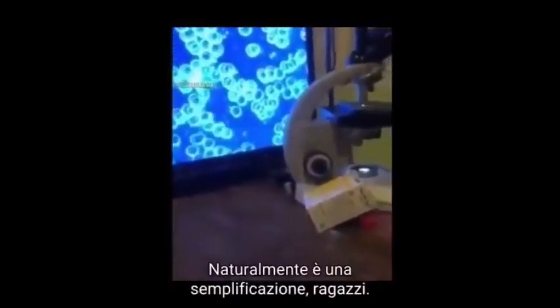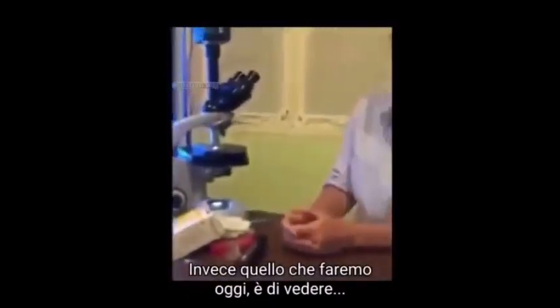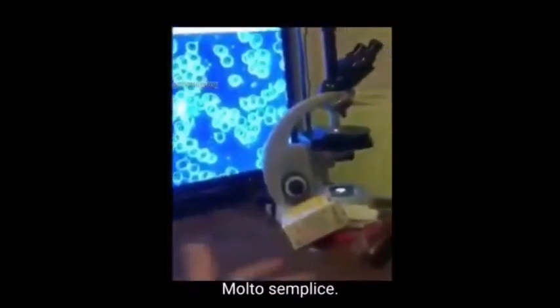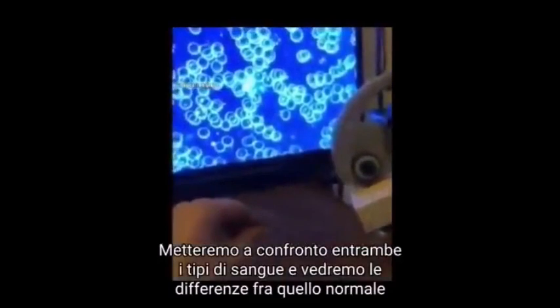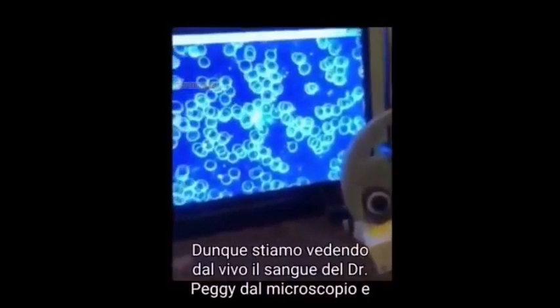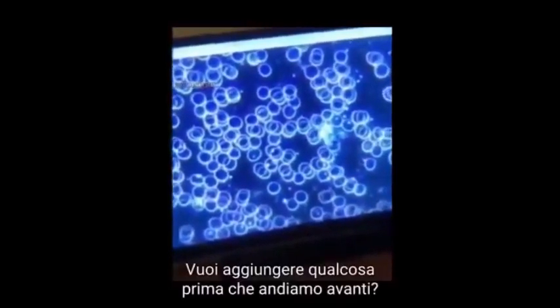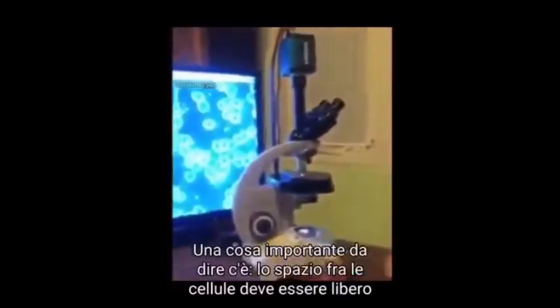This is an oversimplification, guys. What we're going to do today is we're going to see normal blood compared to vaccinated blood. Very simple. We're going to compare both bloods and see normal blood versus vaccinated blood, unvaxxed versus vaxxed. All right, so what we can see, we're looking at a live feed of Dr. Peggy's blood, and we can see good quality blood cells. Do you want to add anything before we look at it? No, that's pretty much it.